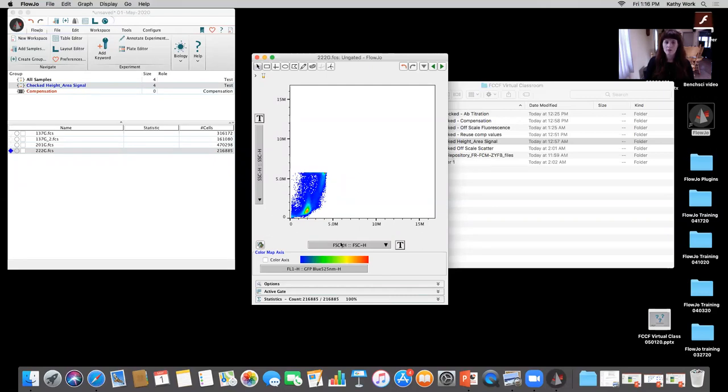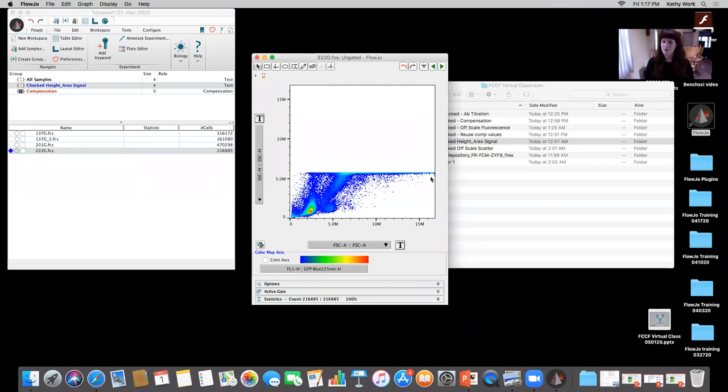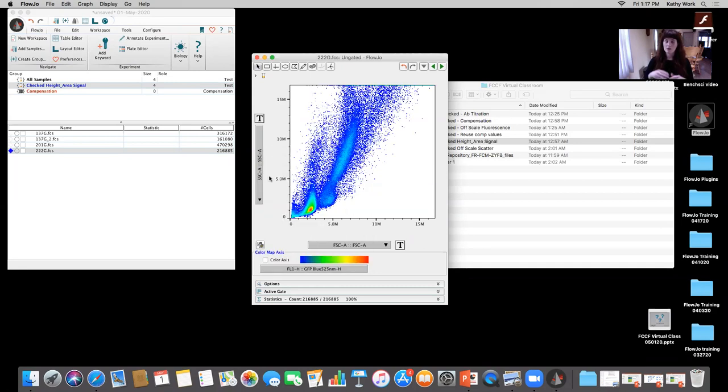A good little troubleshooting tip, if I was curious: does it actually happen on all measurements of forward scatter and side scatter, or is it strictly just the forward scatter height and side scatter height? I can test that quick by coming here and going to forward scatter area. And we can see, all right, it's not really plateauing. It's going out much higher, or it's not saturating. And if I do side scatter area, we can see we're utilizing that whole range in forward scatter and side scatter area, everything looks fine. The data looks fine, right? But does that mean that it's a good choice to have the detector settings as they were for this experiment?